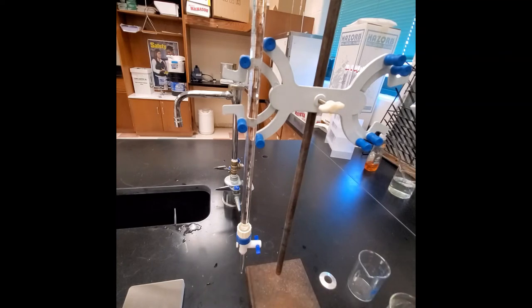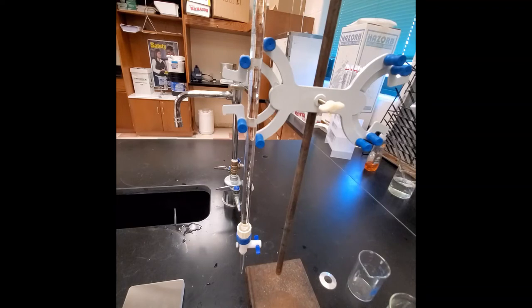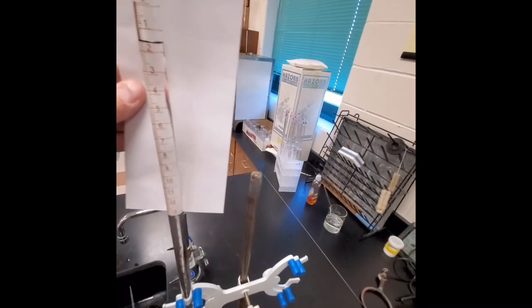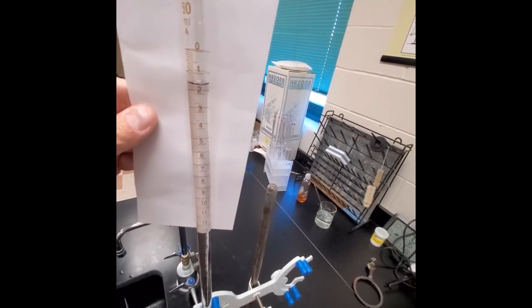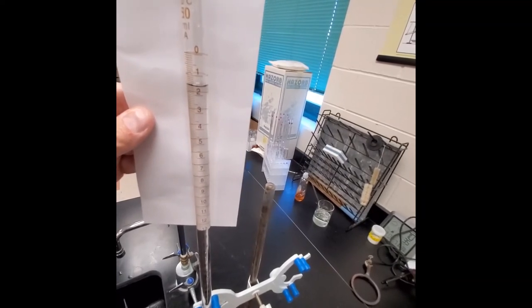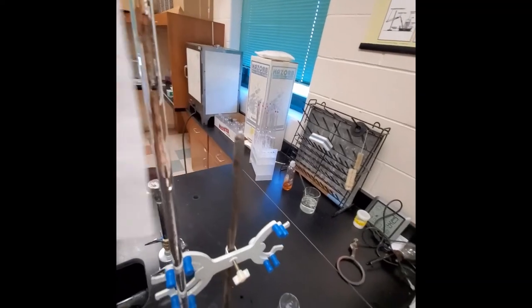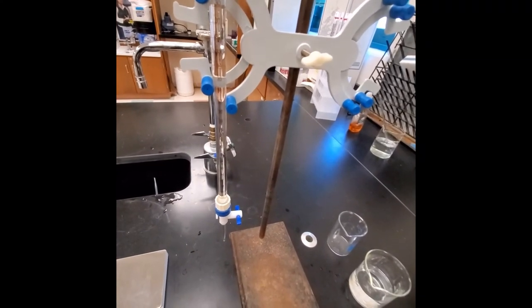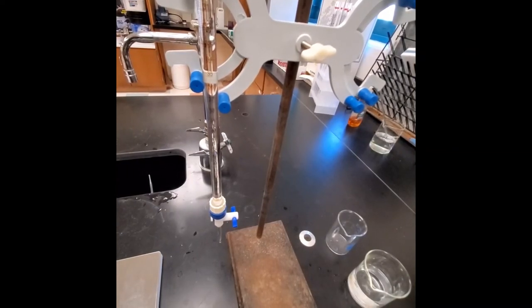Record the initial volume in the burette. It helps to hold a piece of white paper behind it to see the meniscus more clearly. The meniscus will be between markings, and since there are markings every 0.1 mL, all volume readings should be reported to two decimal places, estimating between the tenths. For example, if the reading is 1.57, that is your initial volume.